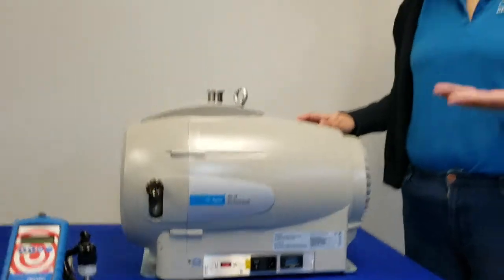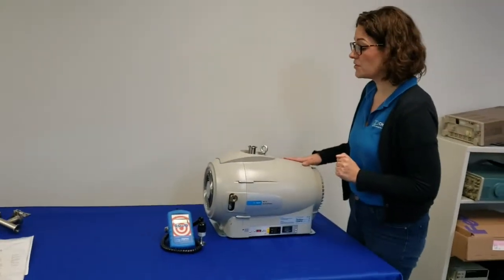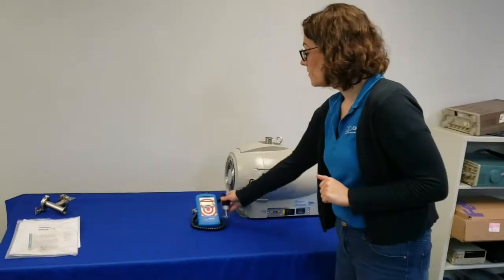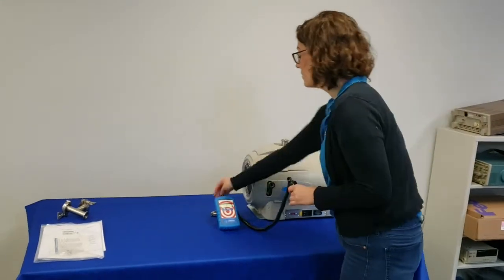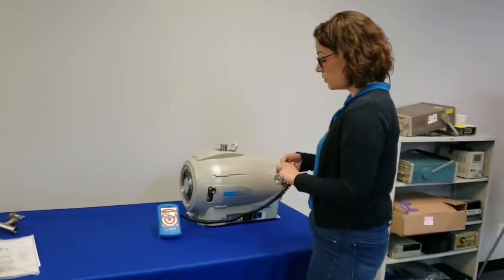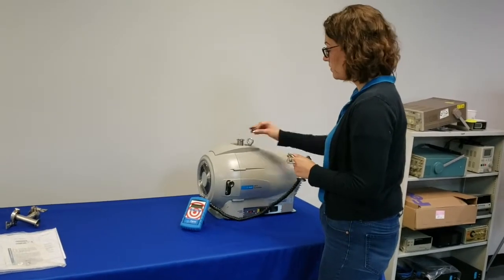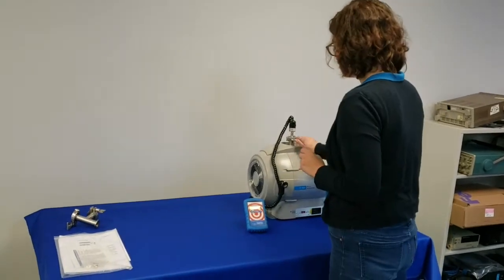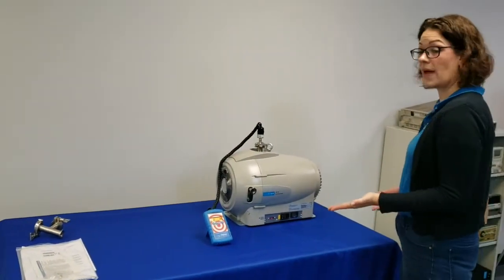In order to test and run this pump, we're going to hook up our Digivac Bullseye precision gauge directly to the inlet of the pump. This gauge comes fitted with a KF25 sensor. We'll use an O-ring and flange to clamp it to the inlet. You'll notice with the pump off, the gauge is reading atmospheric pressure.